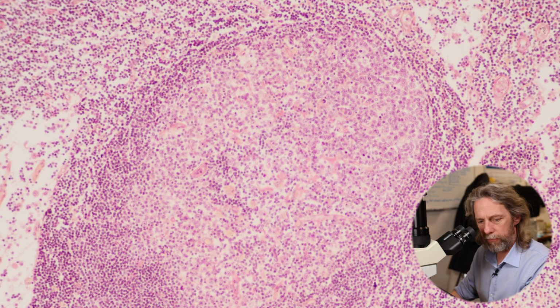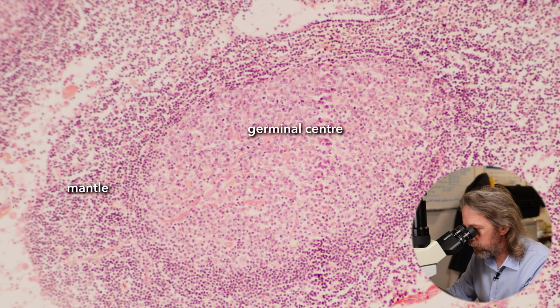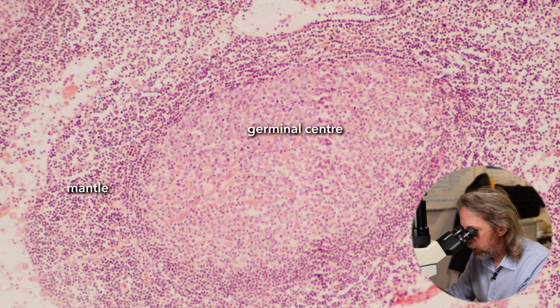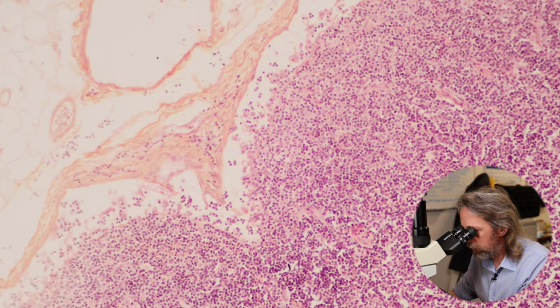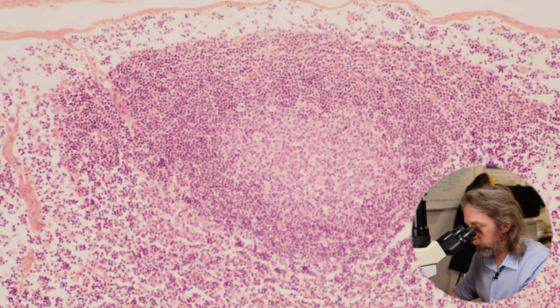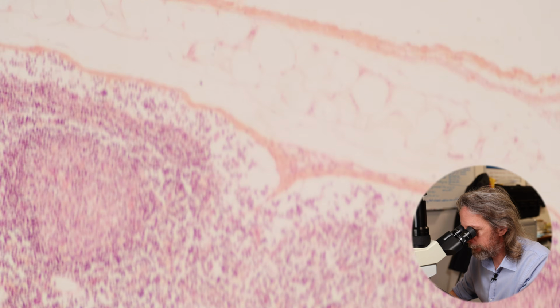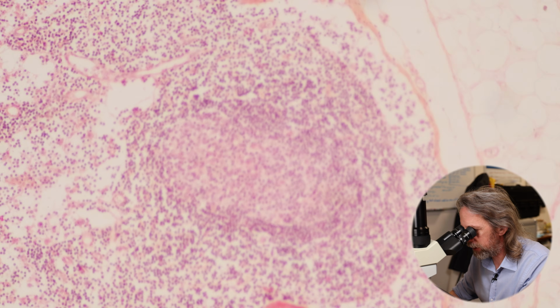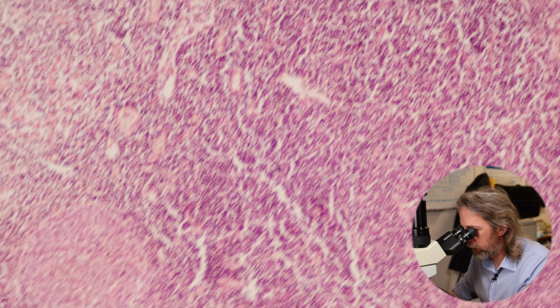So when we look at a follicle, if we see a paler centre like that, that's the germinal centre. What do these look like? They look kind of similar. So you have a paler germinal centre and then a mantle zone around the outside. So we're seeing in the cortex these nodules or these follicles all the way around here.